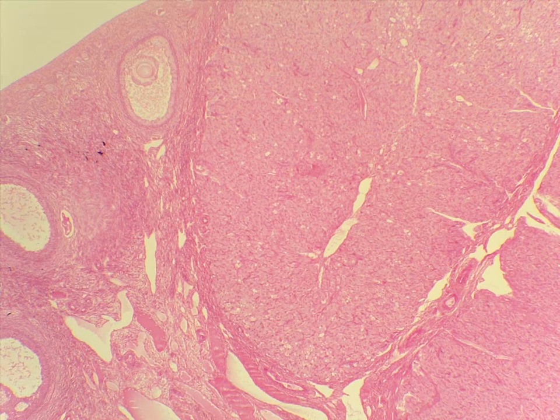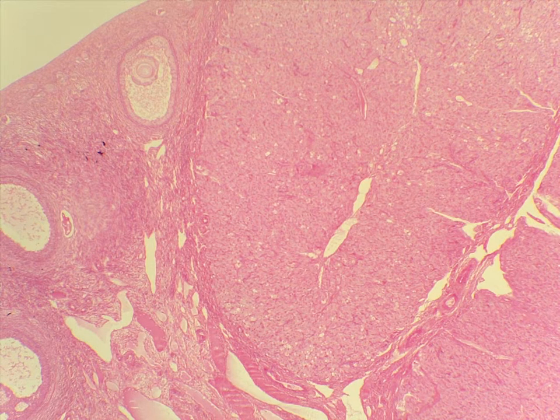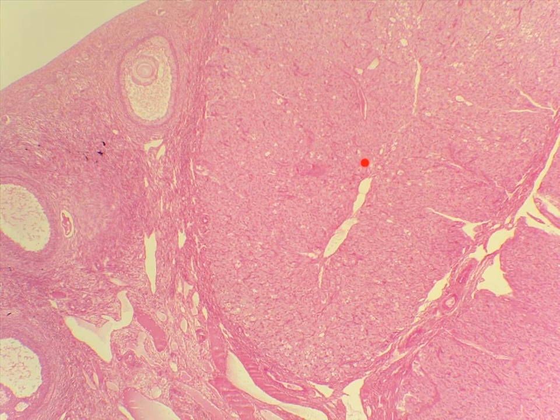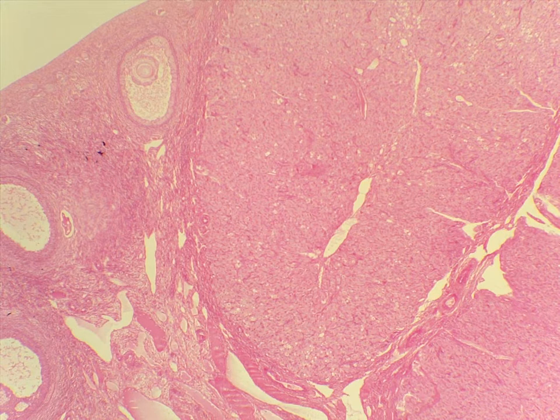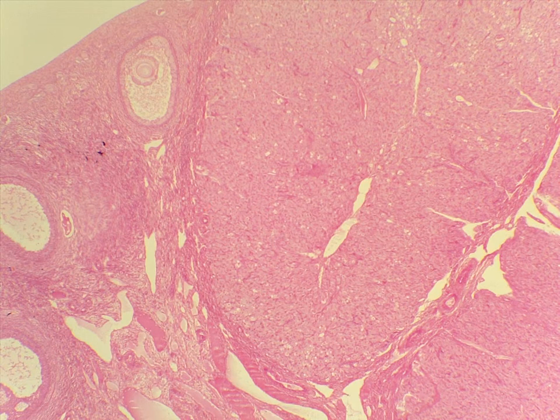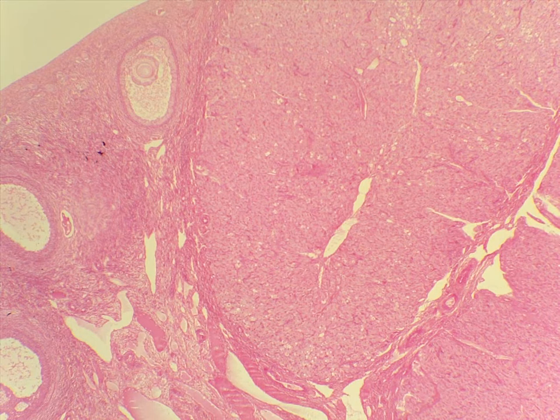This image shows another ovary, in this case after an egg has been released and fertilized. You can see the egg in a follicle, but this large structure here is the corpus luteum. It forms in an ovary after eggs have been released, an egg has been fertilized, and a signal has been sent back to it. This keeps the ovary from producing more eggs — which is important during pregnancy — and produces large amounts of progesterone, which are important for the pregnancy.